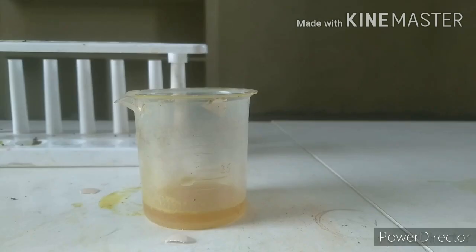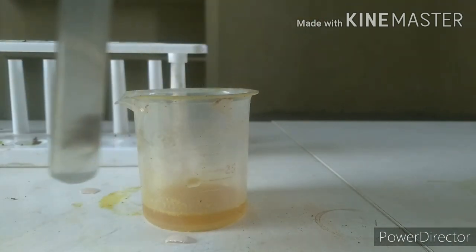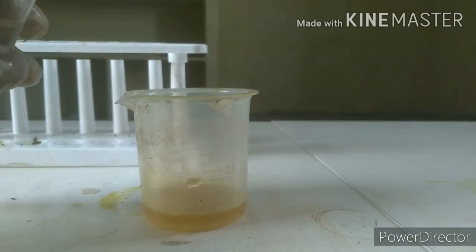I got this filter and I'm going to be pouring a few milliliters of sodium hydroxide solution for this, hoping for a displacement reaction to happen. It's going to be forming calcium hydroxide, Ca(OH)2 plus NaCl, that is the common salt.